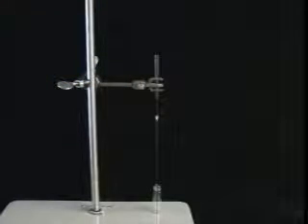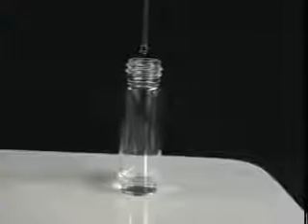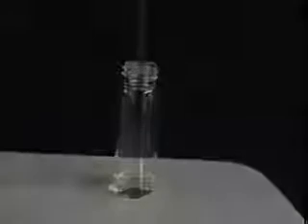Look down at the tip of the filter pipette. Can you see? Squint if you must. The filtered liquid should be draining out into your collection vial. All right, I'll spare you the squinting. Look, our once black mixture is now clear when filtered.